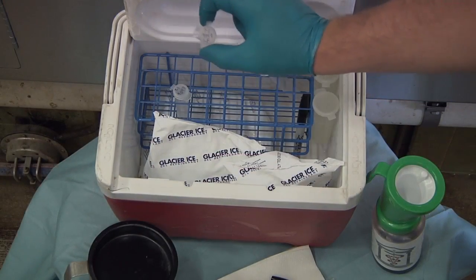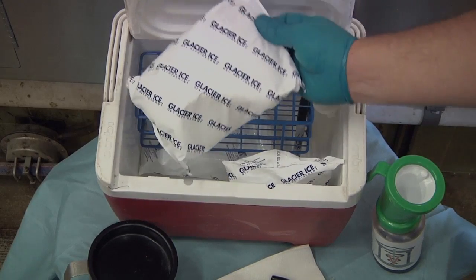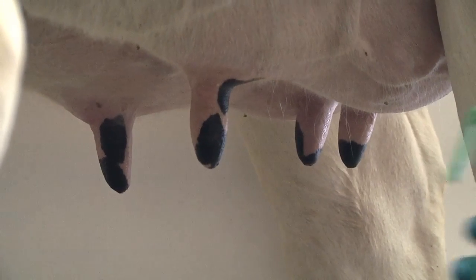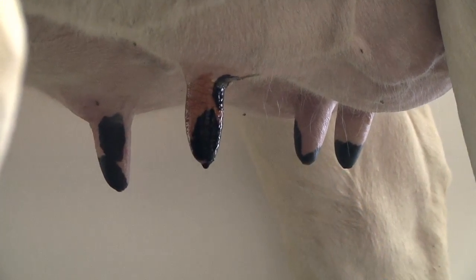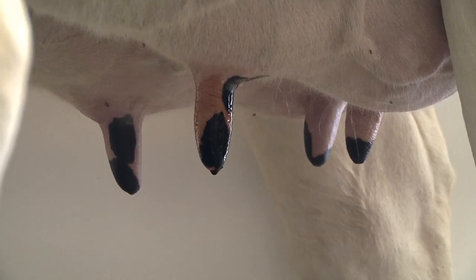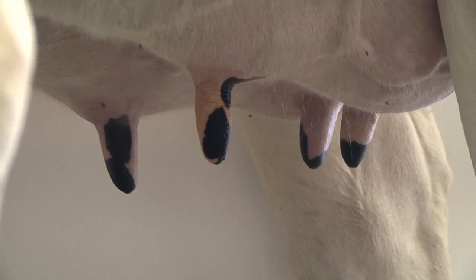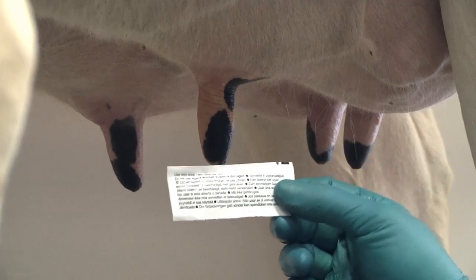The operator should be wearing gloves to prevent bacteria from his or her hands from contaminating the sample. Pre-sanitize the entire teat skin using a pre-milking teat dip and allow at least 30 seconds of contact time. Then wipe the teat dry with a clean paper or cloth towel.